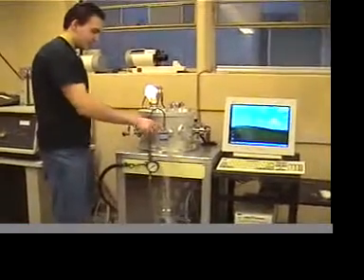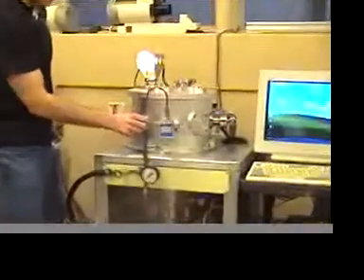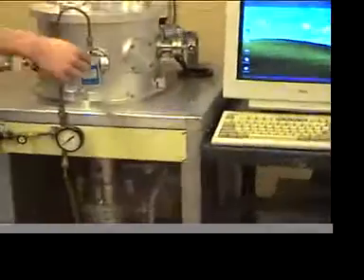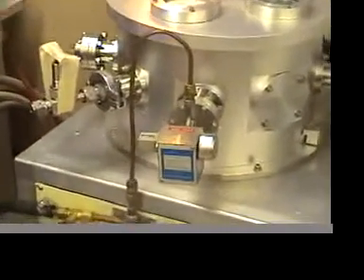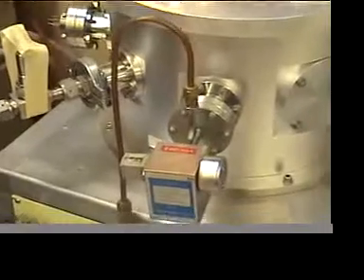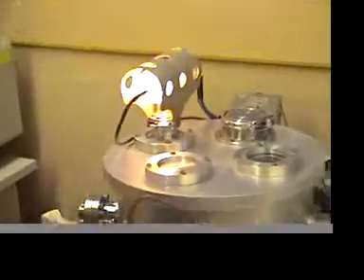it's initially closed at 10. This little knob's at 10. Then you can open it up to 40 to let the gas actually come into the gas handling system and into the analyzer. Once that's done, you can use your computer program to analyze it.